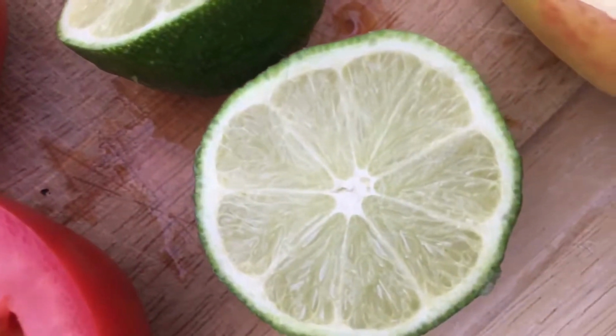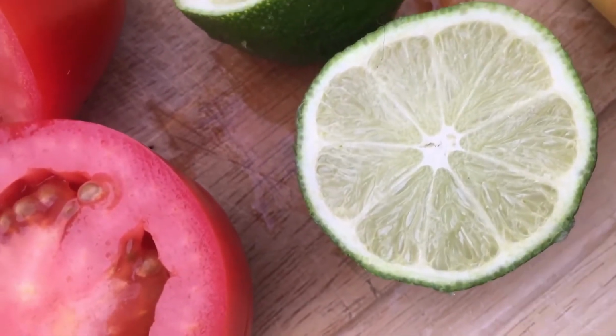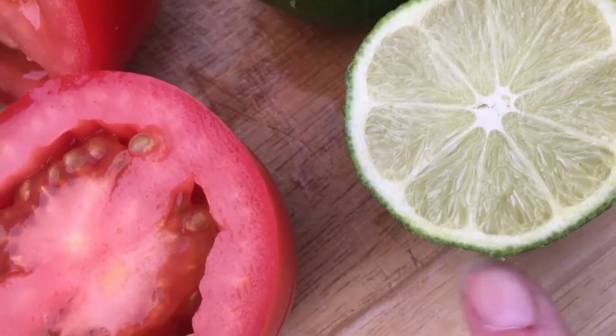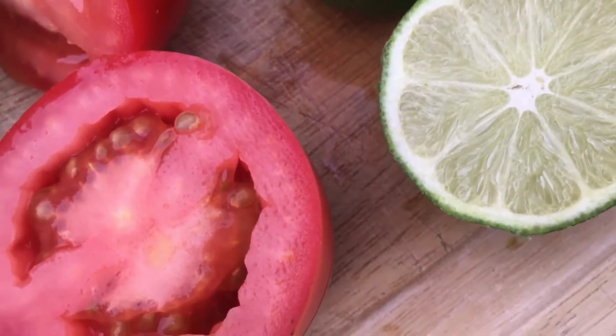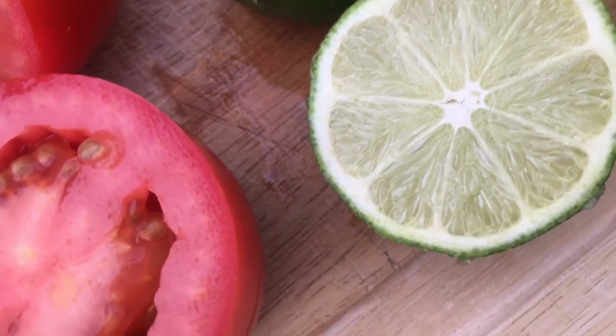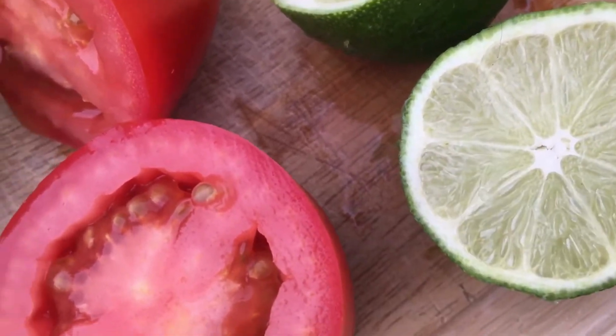And a hesperidium, all the citrus fruits, oranges and lemons and limes, would be a hesperidium, with that leathery rind and the citrus oil glands in that rind. Now this lime didn't have any seeds in it, but normally the seeds would be in here. It would have many seeds.